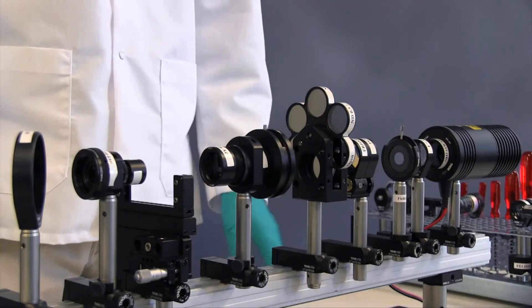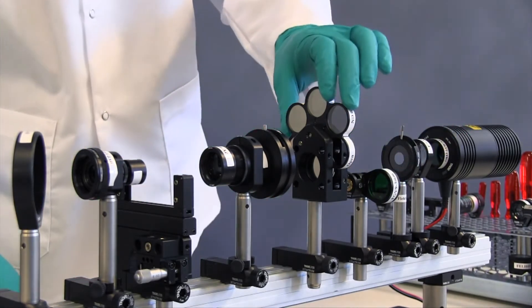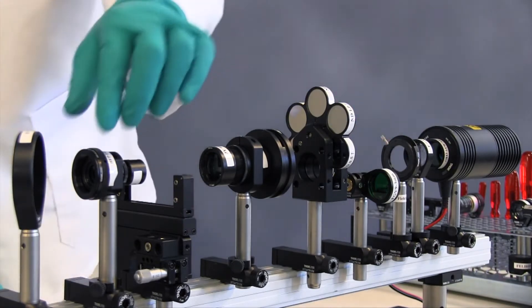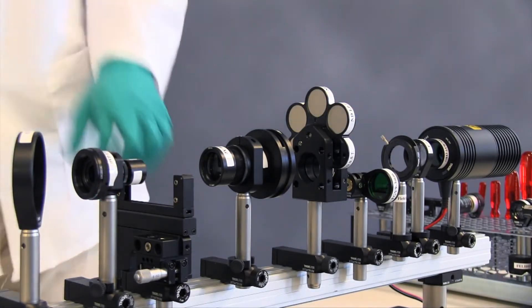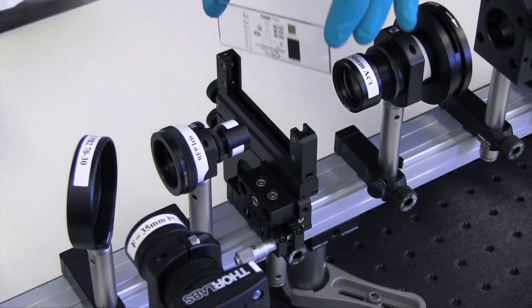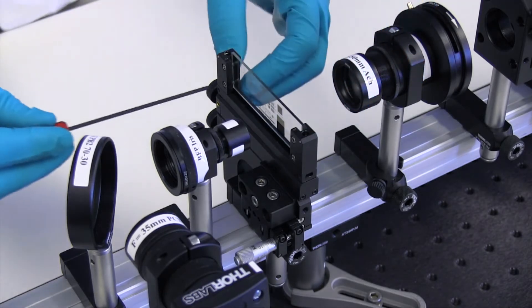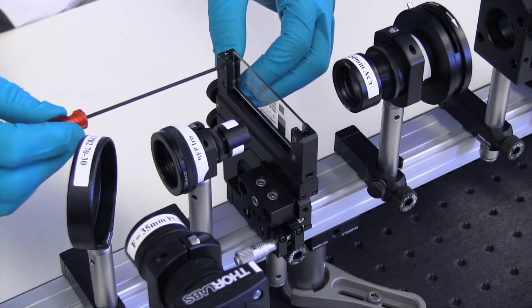To set up for Kohler illumination, flip the filters out of the light path. Open up the aperture iris, field iris, and the back focal plane iris on the objective. Insert the resolution target into the sample stage, making sure the chrome side is facing the objective to prevent spherical aberrations while imaging.